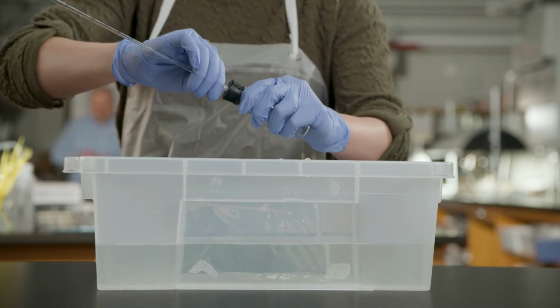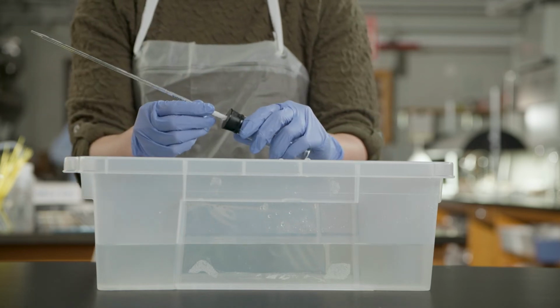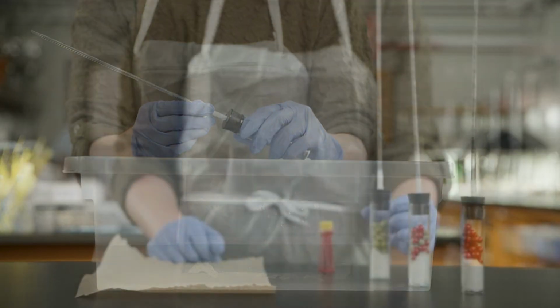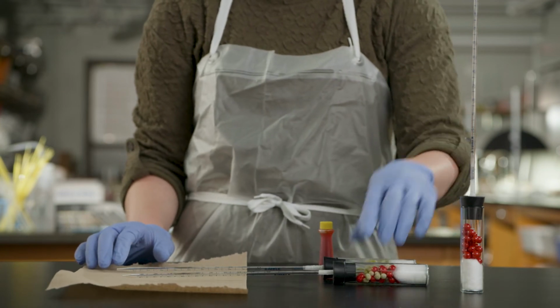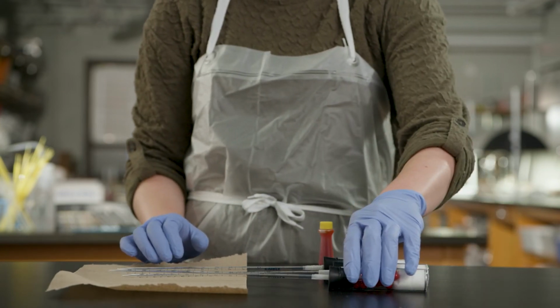Be sure to check all 3 respirometers for leaks. It is better to detect and repair any leaking respirometers at this point before the experiment has begun. If your respirometers leak during the experiment, you will need to restart the experiment from the beginning. Follow the steps in Activity 1 of the lab manual to assemble the contents of the respirometer vials.